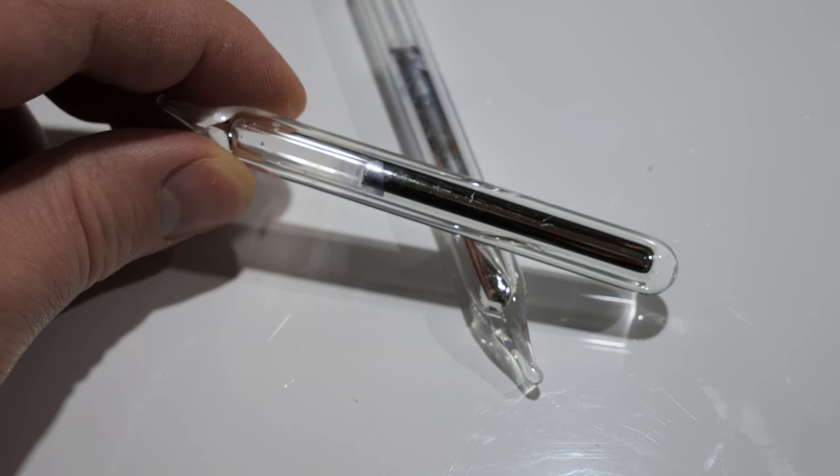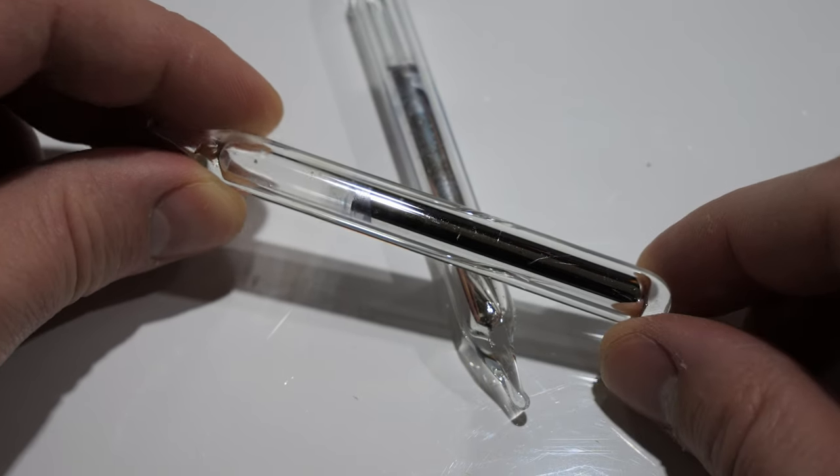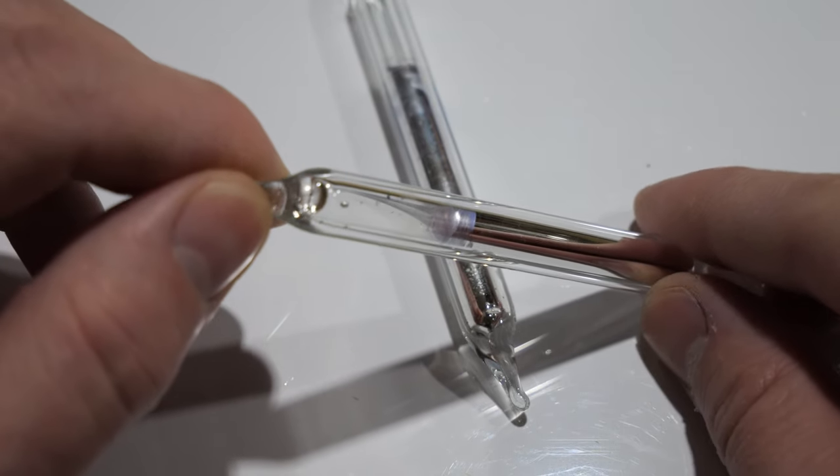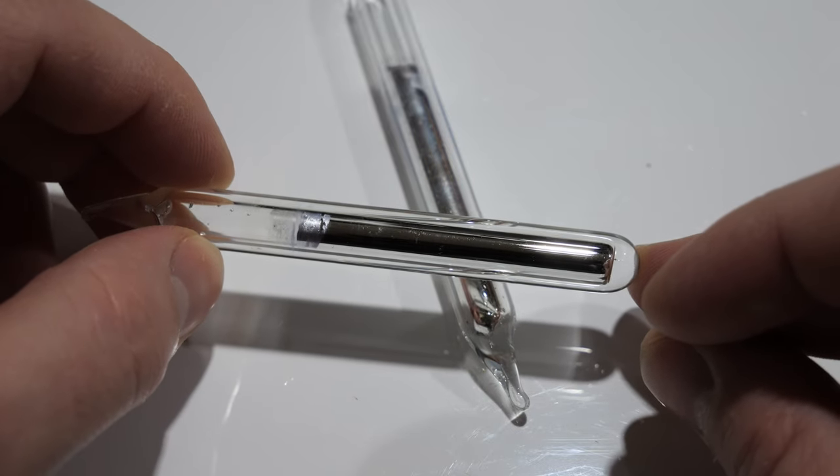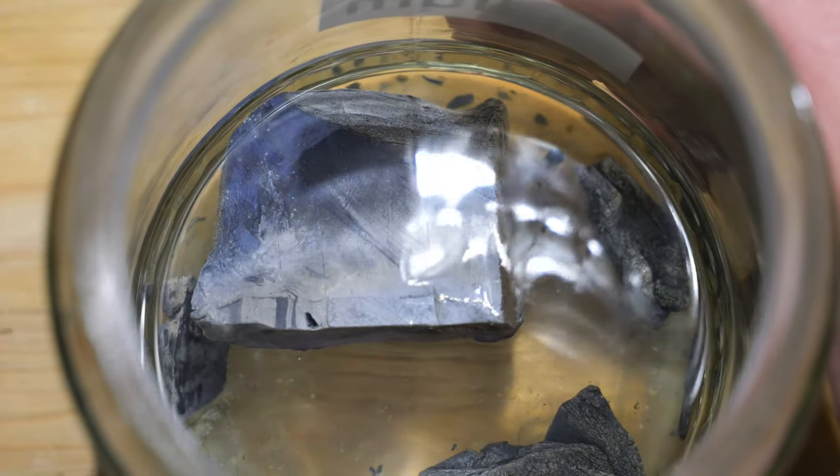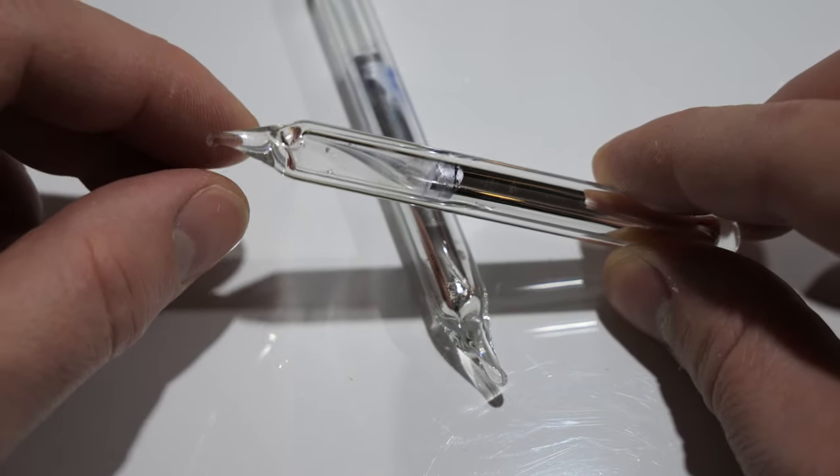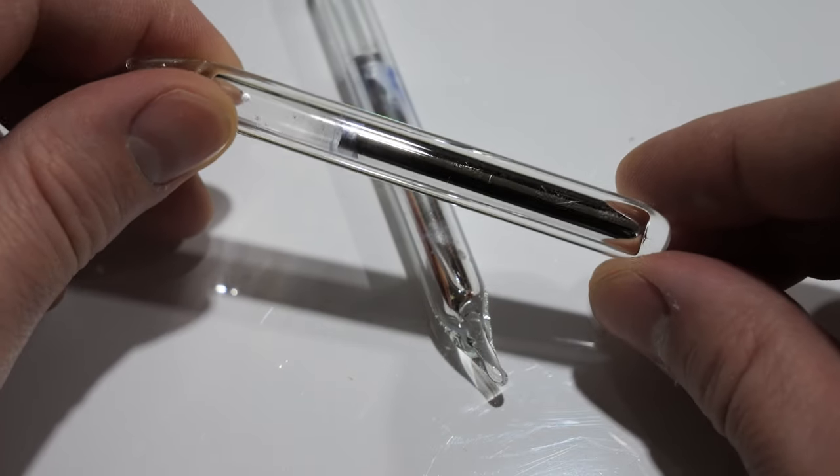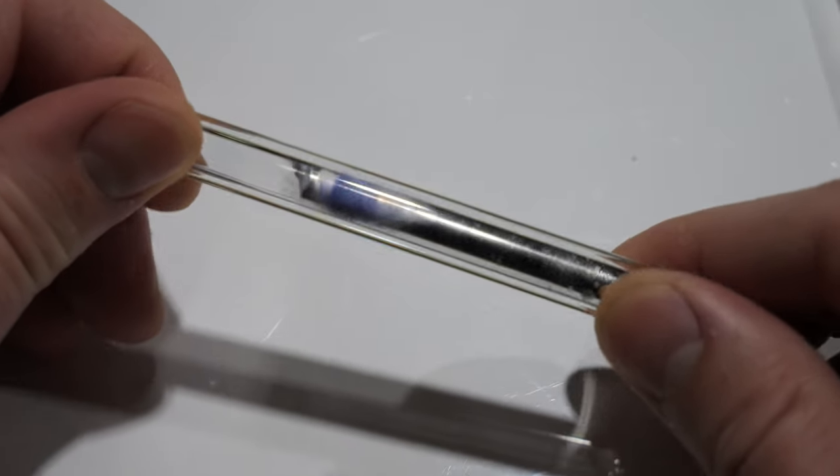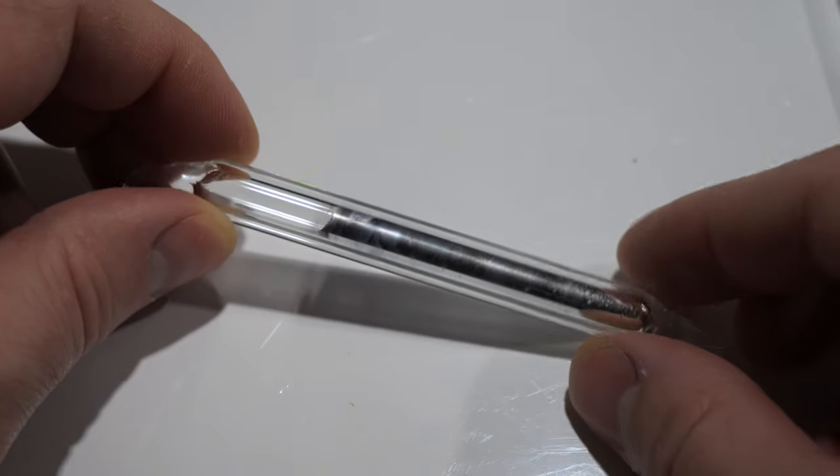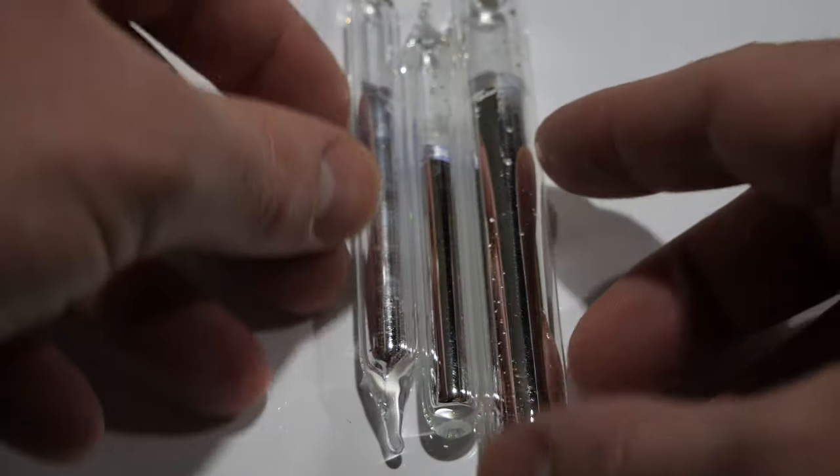The resulting ampoules were also not as pure as I would have hoped. But for a first try, and considering that I never tried this method before, I think it's acceptable. I am not sure what I'm doing wrong. I suspect that it didn't do a good enough job excluding any moisture and oxygen. Or the potassium I started with was too contaminated to be cleaned up by this method. As soon as I have a proper Schlenk line available and I will be able to dry the argon, I will test it again and melt off the ampoules under argon atmosphere. In addition, I will lengthen the glass tube so that the contaminants have more time to adhere to the glass surface. Maybe I will even purify the ampoules a second time using this method to get a satisfactory result.